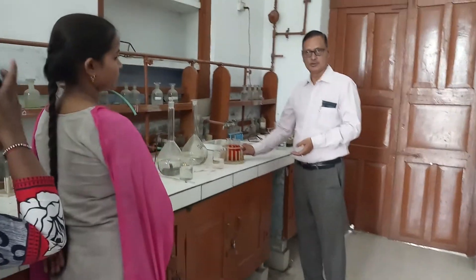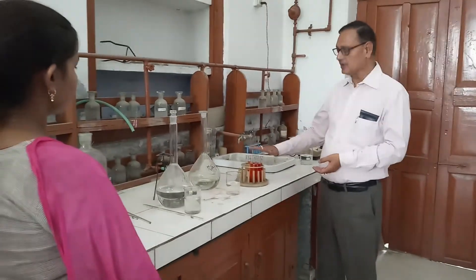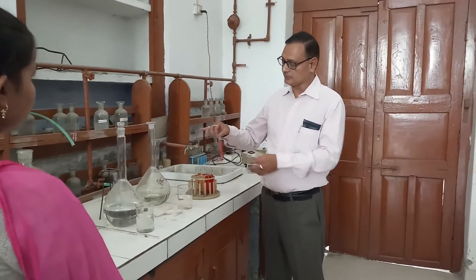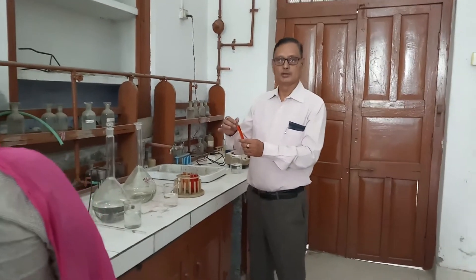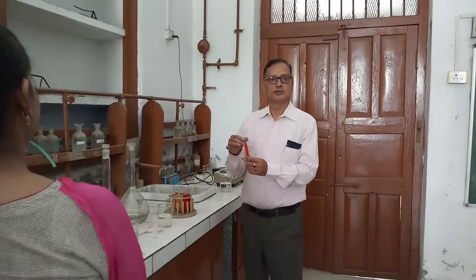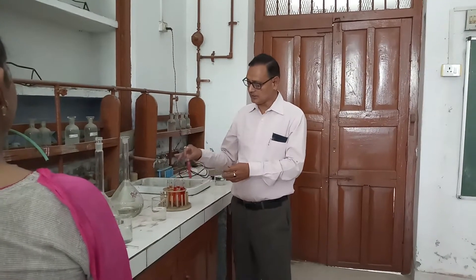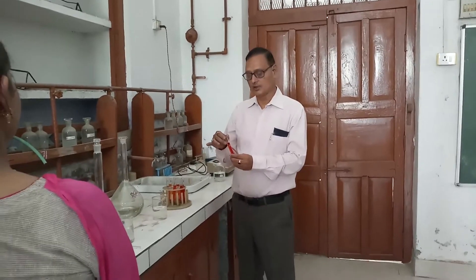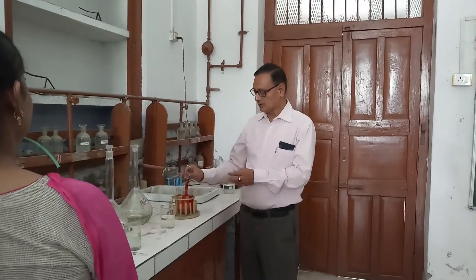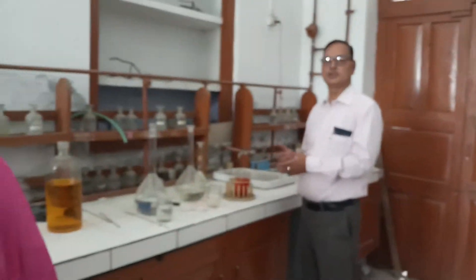For preparation of different molar ratios, I have prepared 10 sets of solutions. In the first test tube, we take 1 mL of iron solution and 9 mL of 1,10-phenanthroline. In the second test tube, we have taken 2 mL of iron and 8 mL of 1,10-phenanthroline. Likewise, we have prepared a number of solutions having different molar ratios.